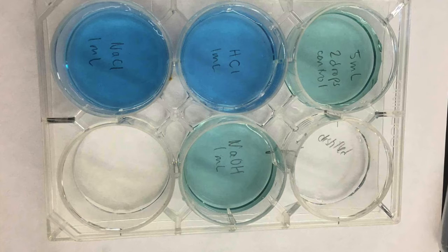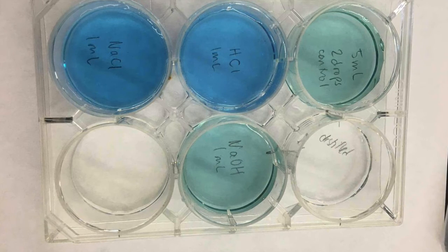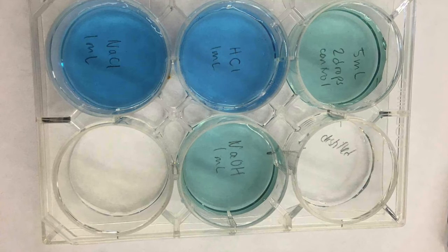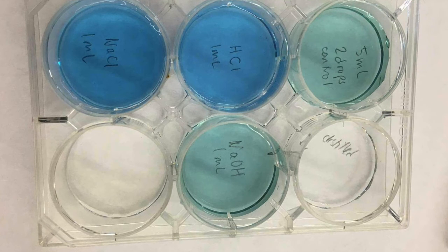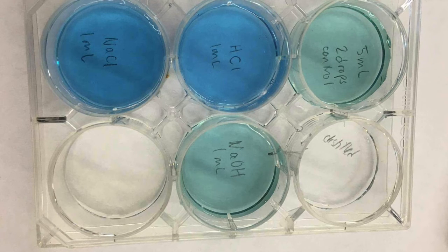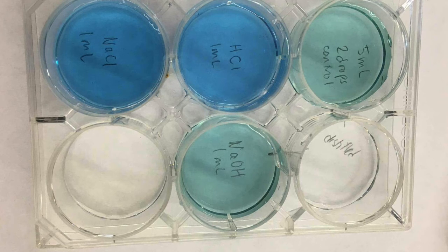What is surprisingly odd is that the other two cups, the one on the far left and the top middle, are not a turquoise color. In fact, it is a dark blue, and when referring to our pH test color chart, we can see that having a blue color means that it is basic. That's right, our school tap water is basic and might not be the healthiest option for us.